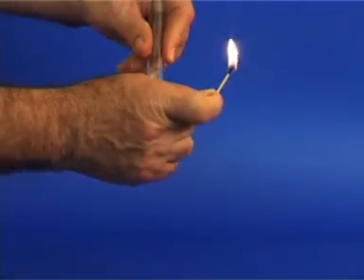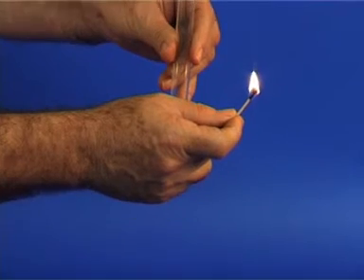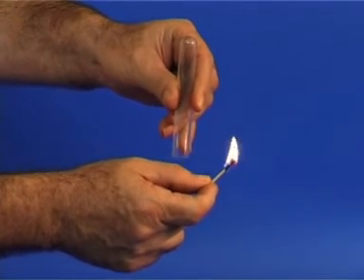To examine the hydrogen test tube, light a match and bring it close to the mouth of the test tube. Note the noise it makes.